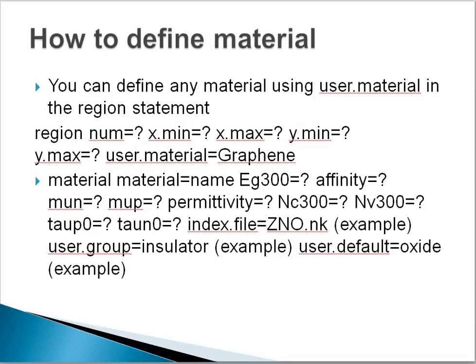Before you go to the code, first you must know how to define a material in Silvaco. You can define any material using user.material in the region statement. Region number, specific number, with the positional parameters x minimum, x maximum, y minimum and y maximum. User.material, for example, graphene. You can give any name in place of graphene. Next, you have to define the material name. Any name you can use. You can use graphene, alpha, beta, any name.